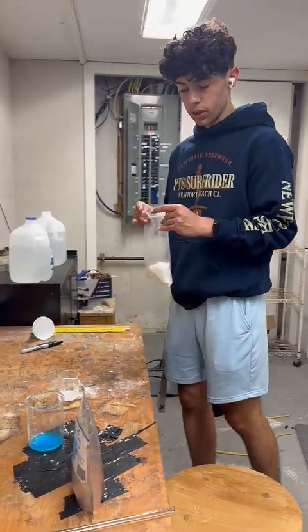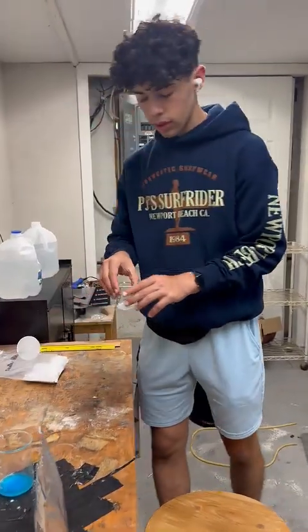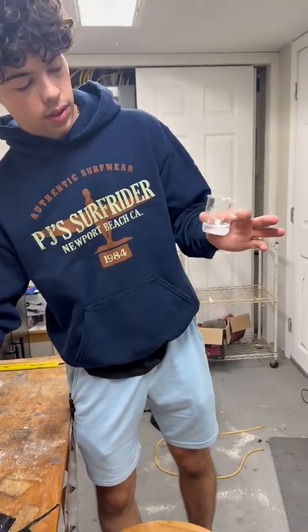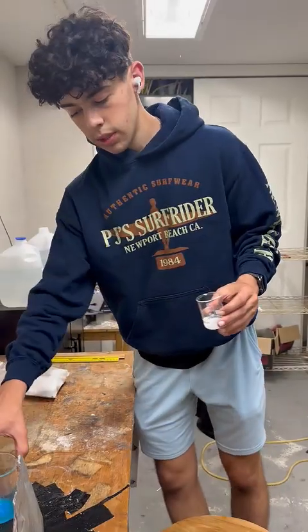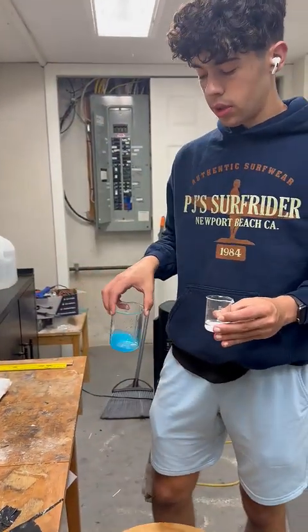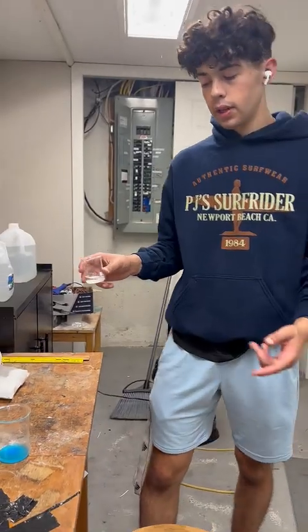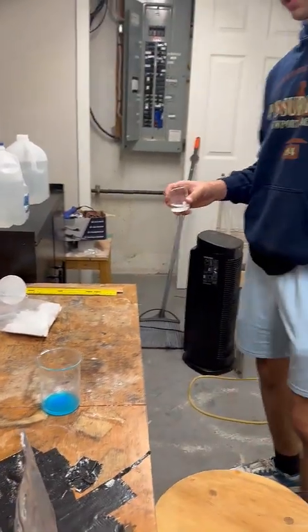And it's probably enough. And so pretty much this is a weak acid, it's pretty much a form of sugar. And then you have this copper sulfate. So it's just a double replacement. So you have your H goes with your sulfate, and your copper goes with your oxalate.